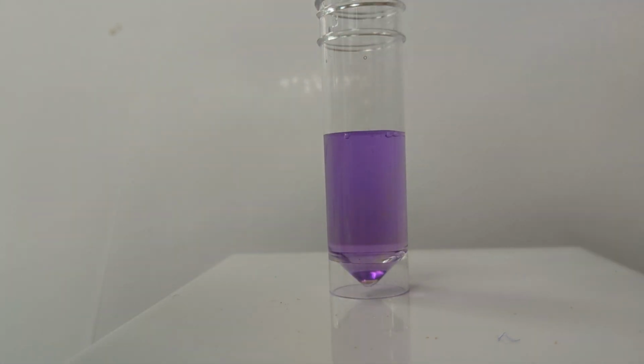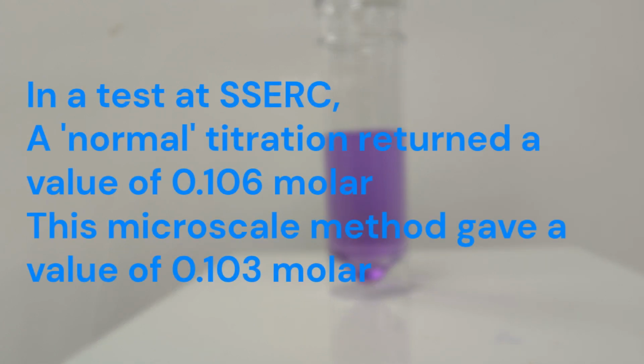Once the reaction has finished, we can divide the number of drops added by our test value to get the value in cubic centimetres, and then we just carry out the calculation as we normally would for a standard titration. To be fair, this is not quite as accurate as a standard titration, but it's still pretty close, and it does have the great advantages of being faster, easier and less expensive to carry out.